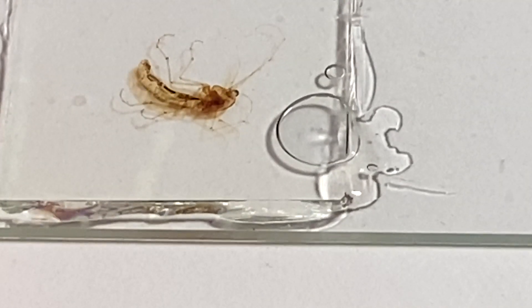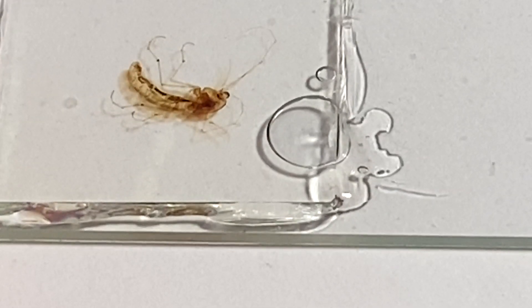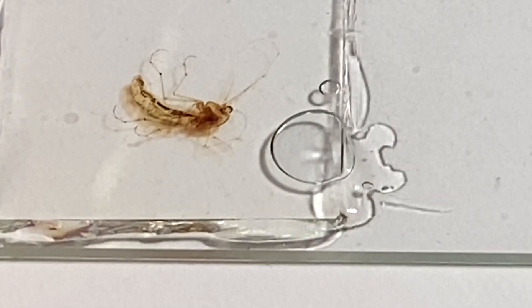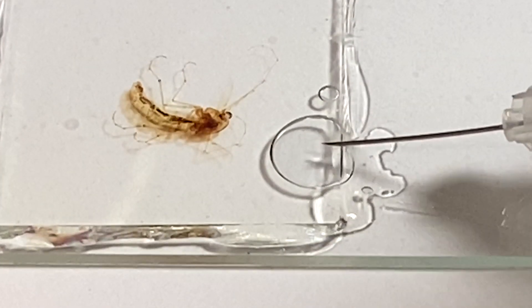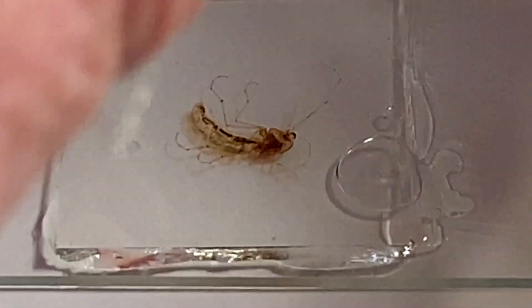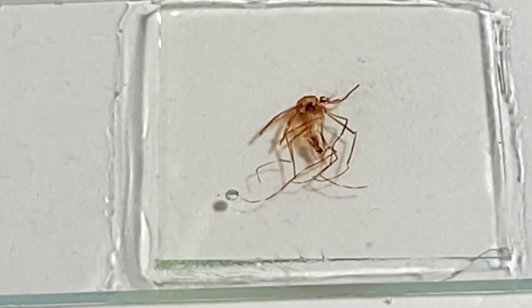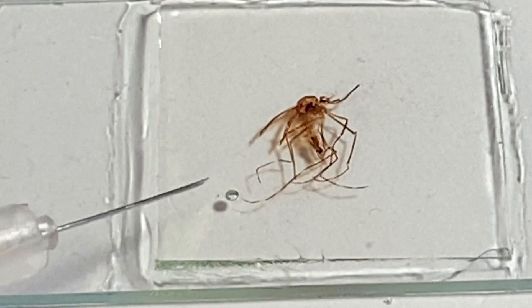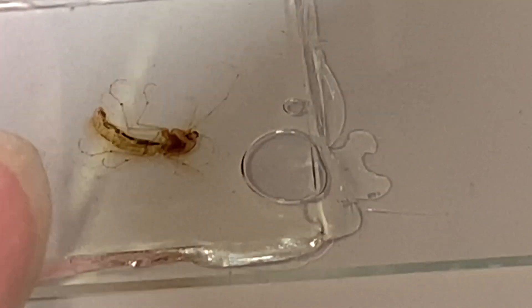To be honest with you, I have had a terrible time making slides without bubbles. My success rate in having a slide without a bubble is less than 10% — maybe even 5%. So most of my slides have bubbles in them. This is not an exact science and a little bit of art is required. I'll deal with bubbles that usually end up on the side, or if we have time, I'll show you another mosquito slide where we have a bubble in the middle — how on earth do you get that bubble out?